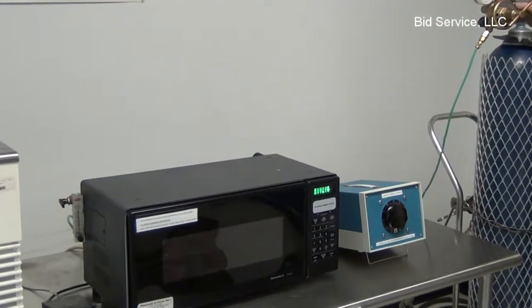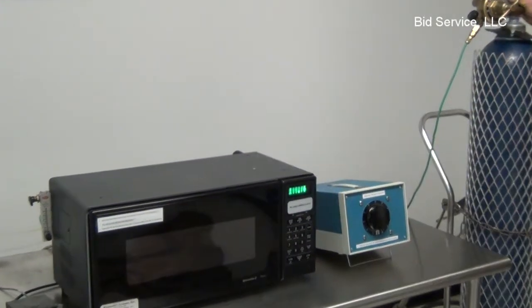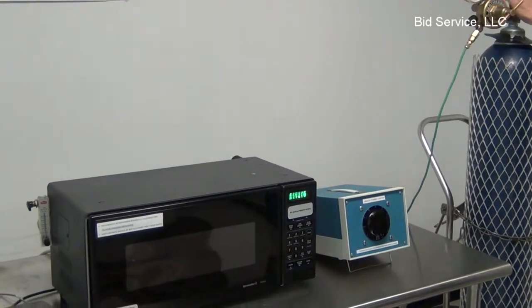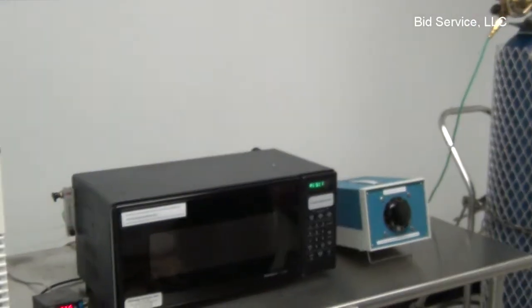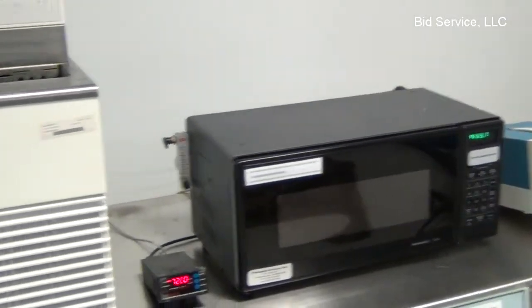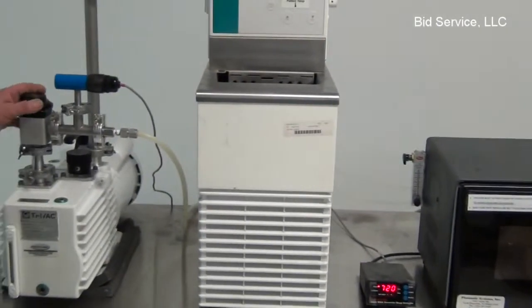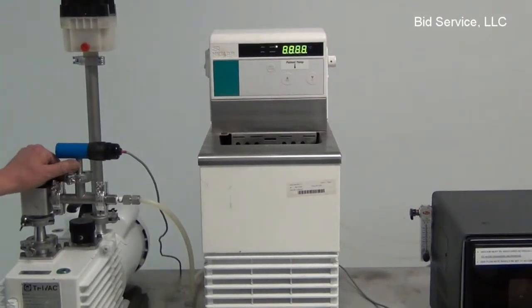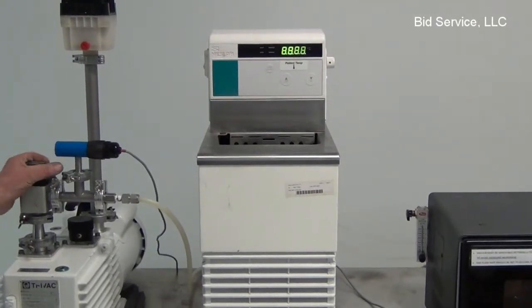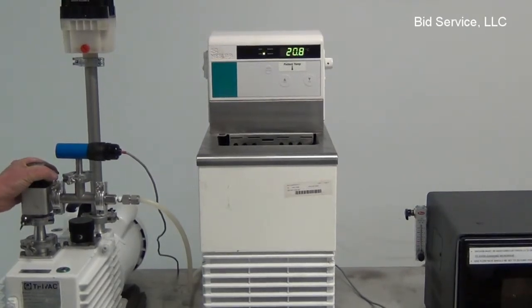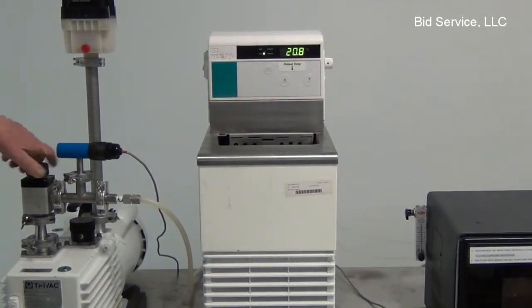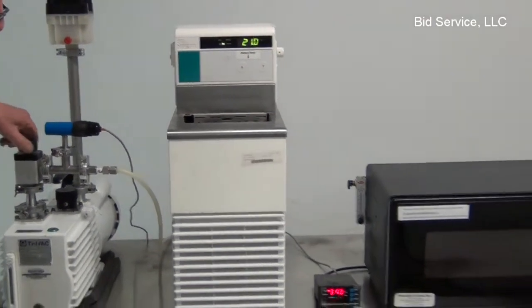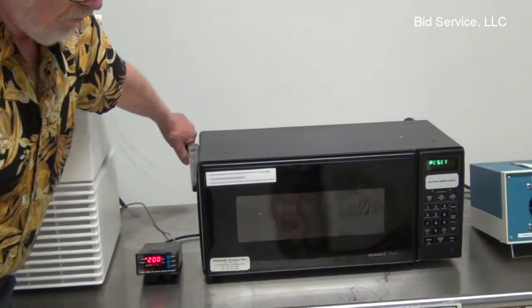First, as I mentioned earlier, we have our source of argon gas. In this case, we have our vacuum pump along with our water supply. Now, before we can operate the oven, we have to first establish a vacuum level. This is very important. You close the purge valve.